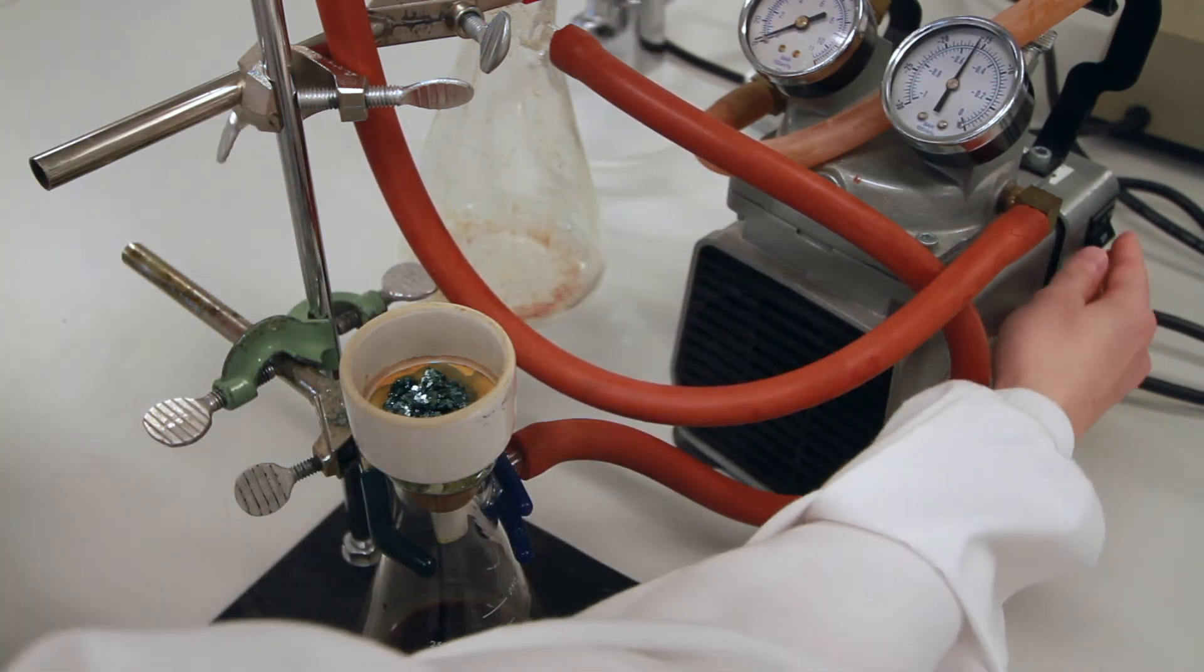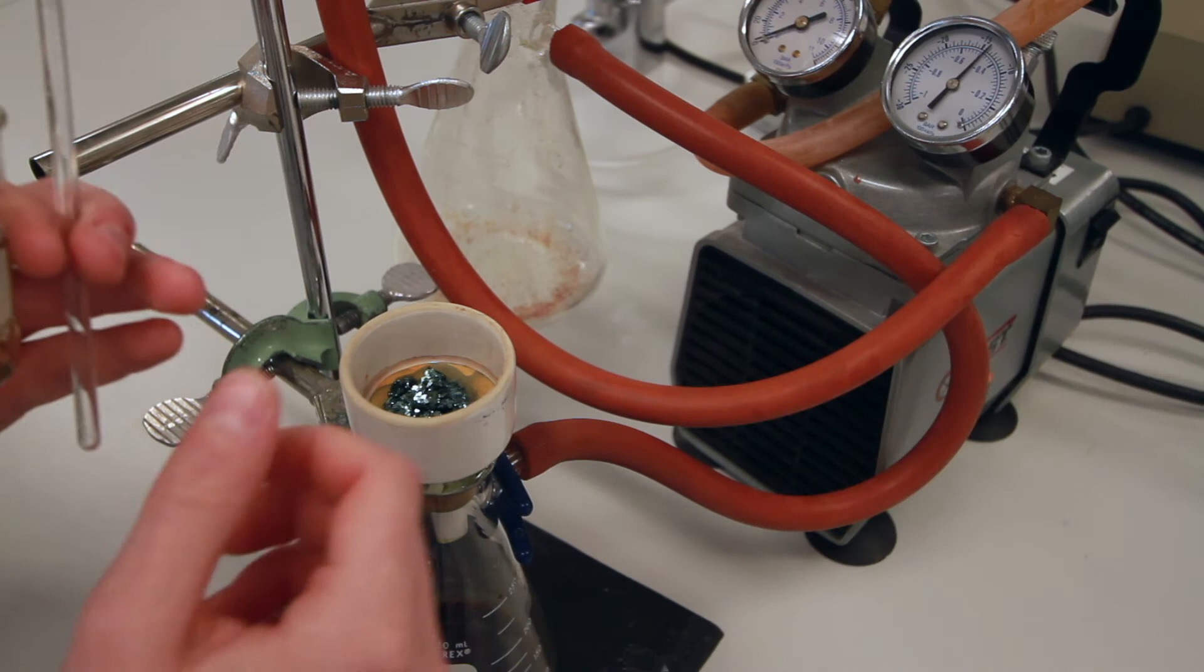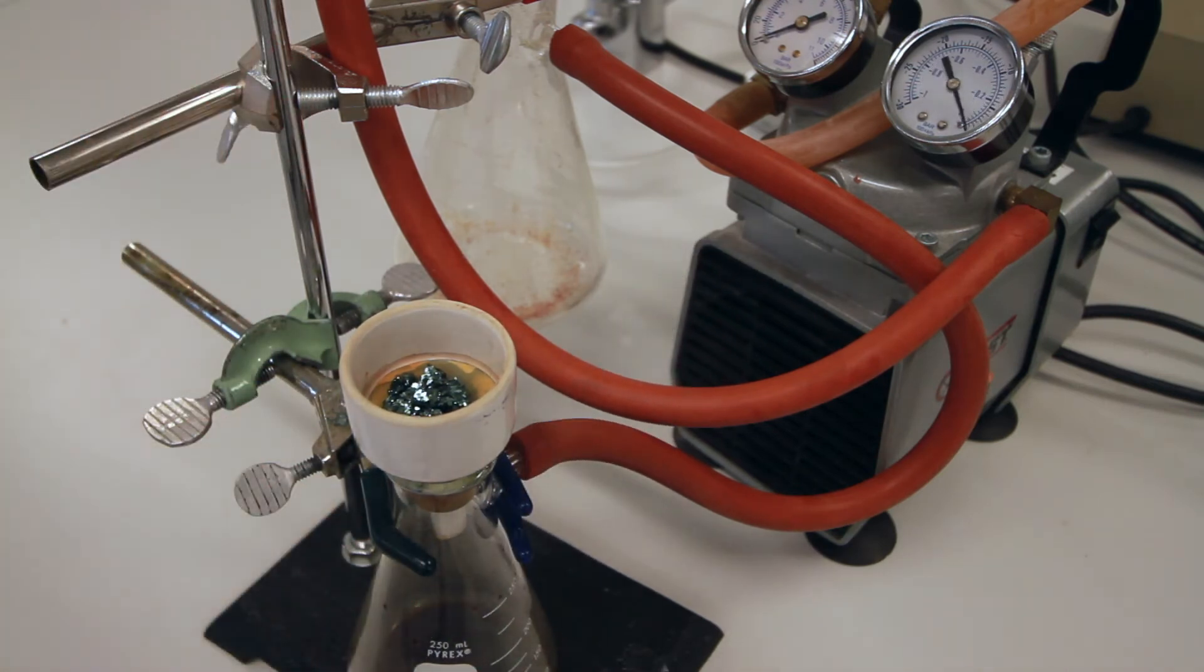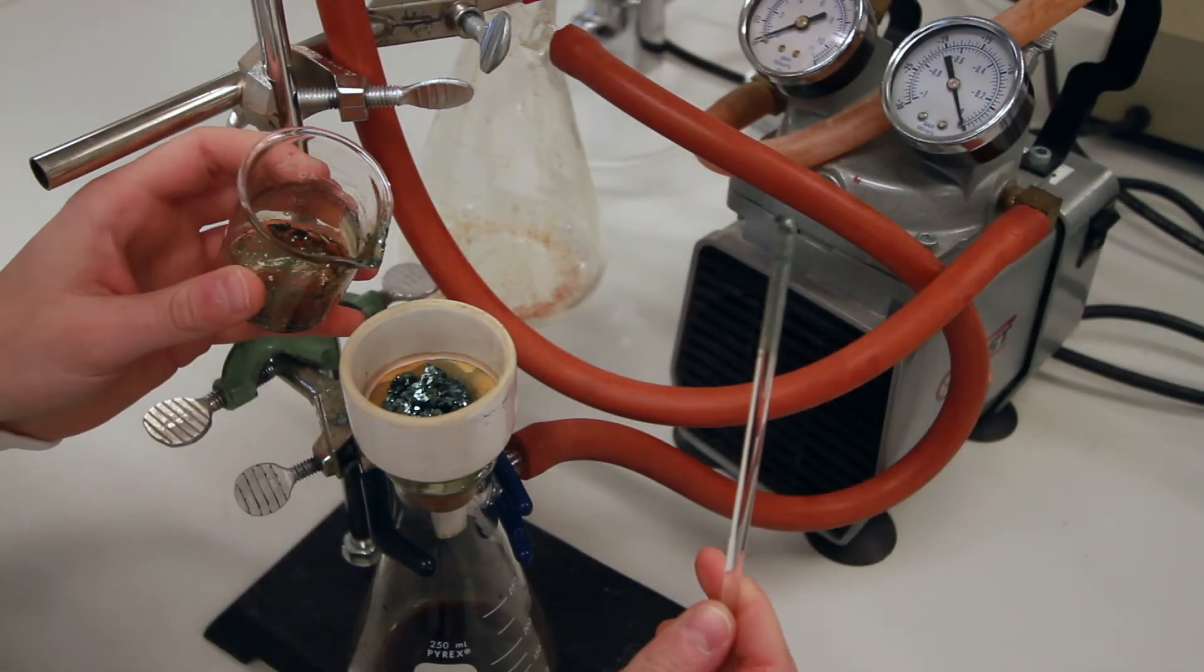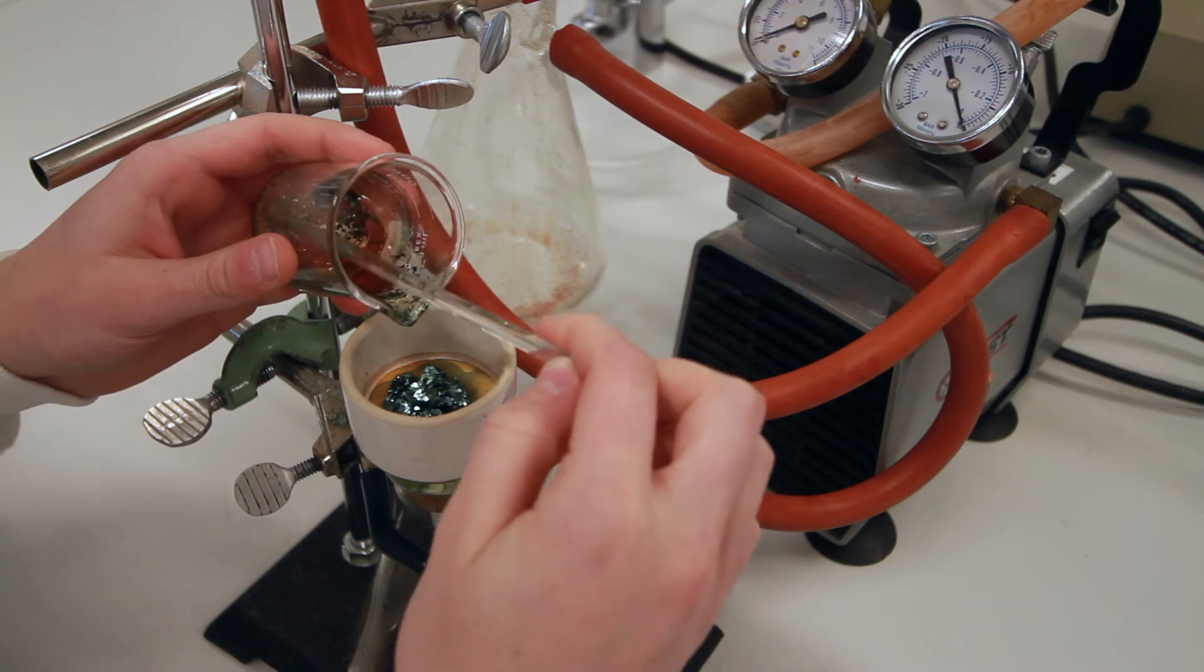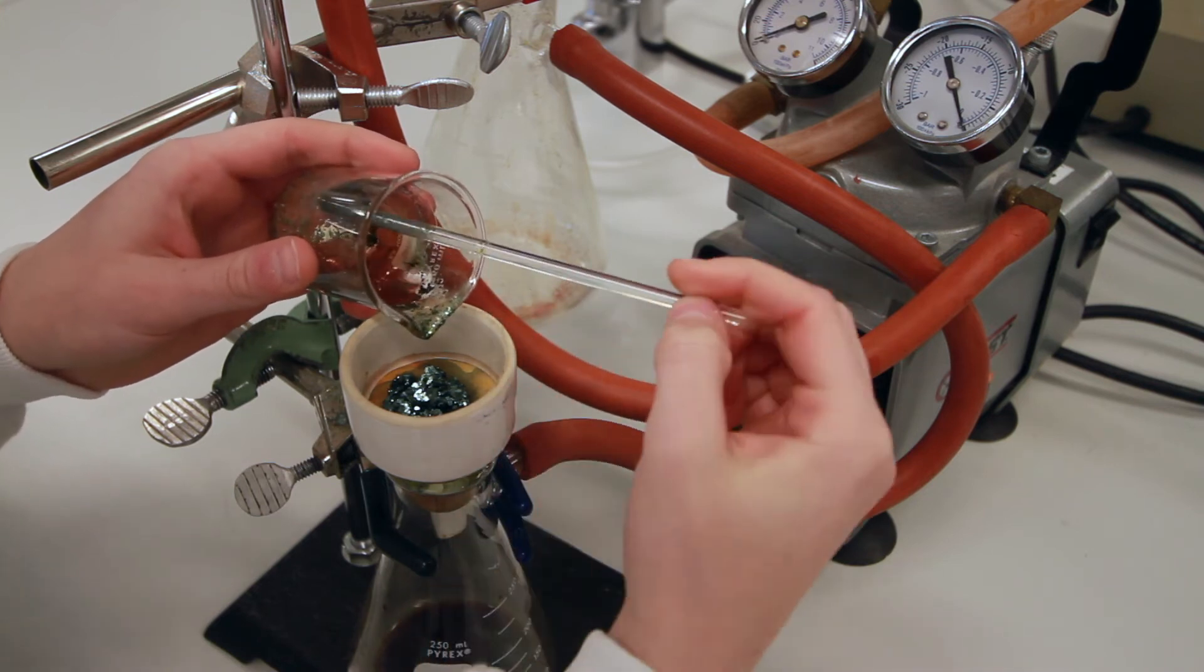Turn off your vacuum pump and obtain your wash solution in the same beaker that your crystals were in. Slowly pour your wash solution over your crystals, scraping your crystals out again.